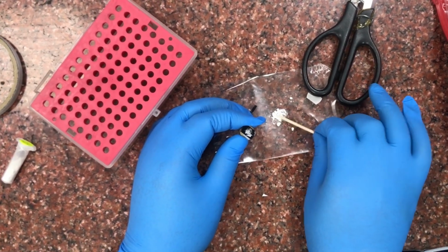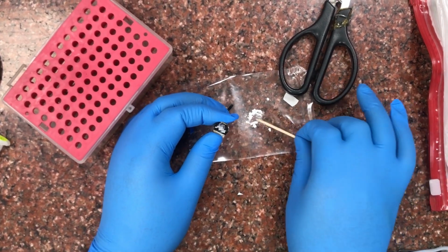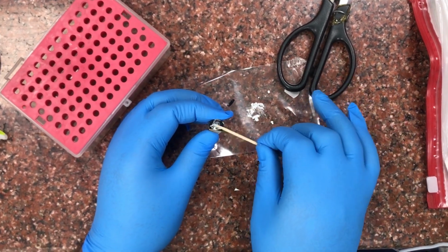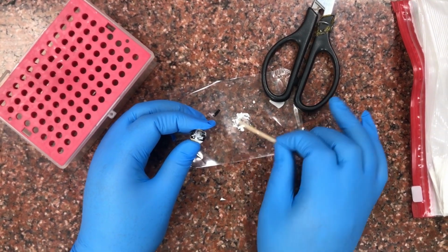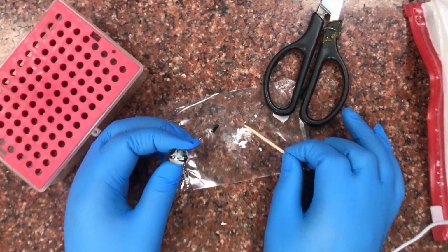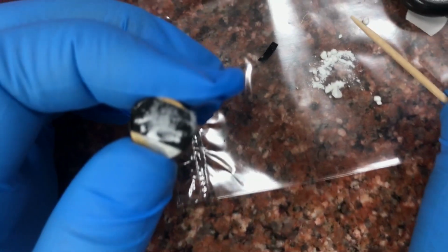It is very essential to spread it as a thin layer, because only then can we see the particles properly. And at one point the thin layer should be even thinner, so that it can be seen properly. A very thin layer is made.